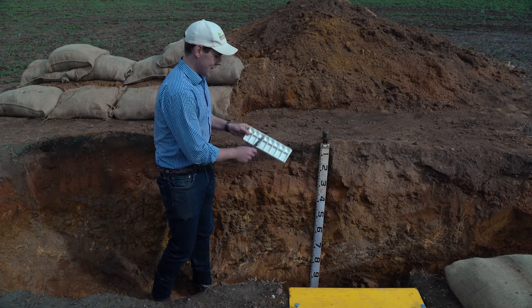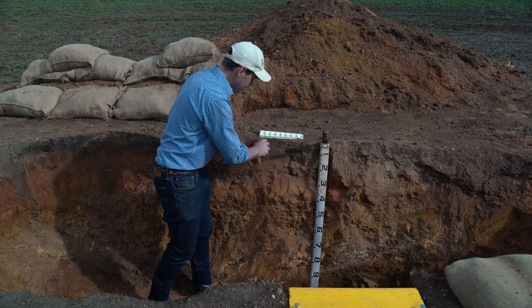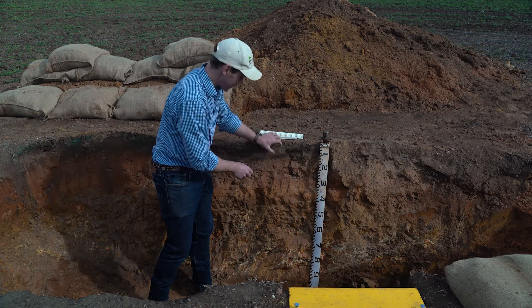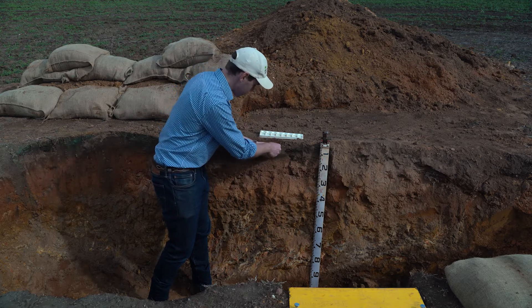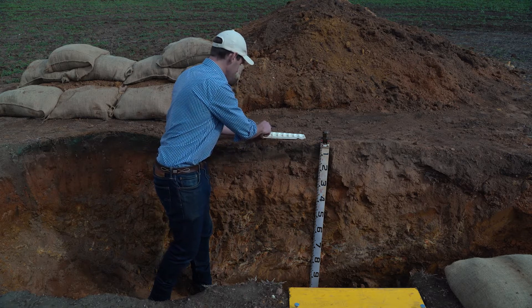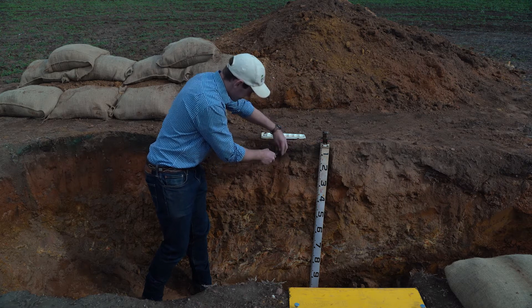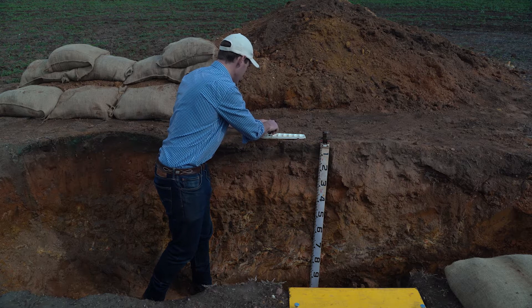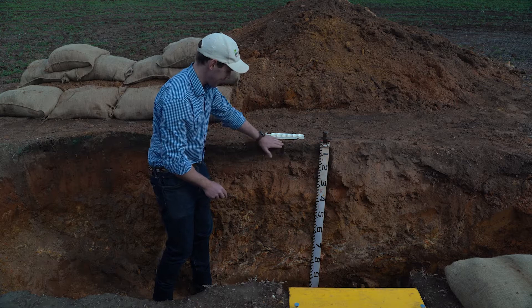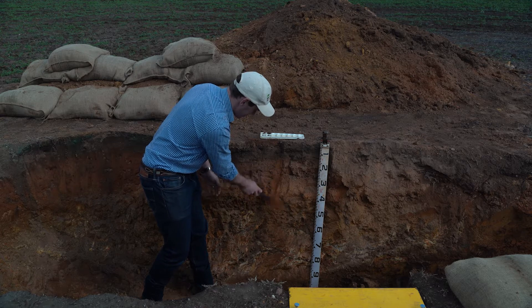I like to use a paint palette to work our way down through the profile. It's great to identify a couple of layers within the topsoil — the top and the bottom of the topsoil. You usually get a bit of a sample out of the topsoil and put that into the tray, then go down to the bottom of the topsoil to see if there are any changes. We can start seeing what's called stratification, where we get layering in the pH. Then we identified a change in colour showing us a second layer.